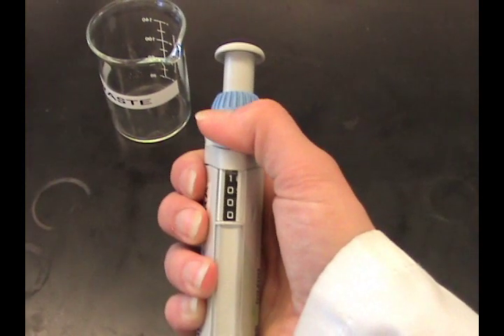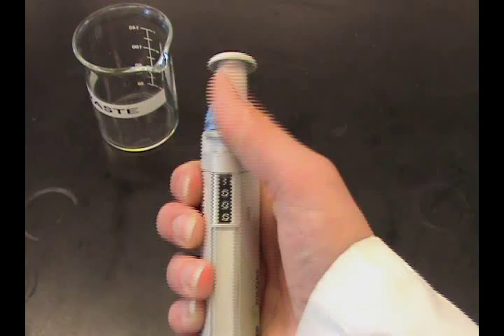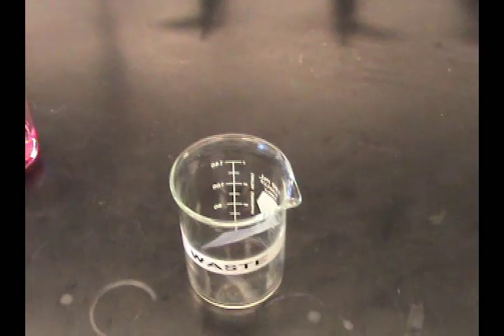Remove the tip by pressing the ejector button and discard the tip appropriately. A fresh tip should be used for each aliquot to prevent sample carryover.